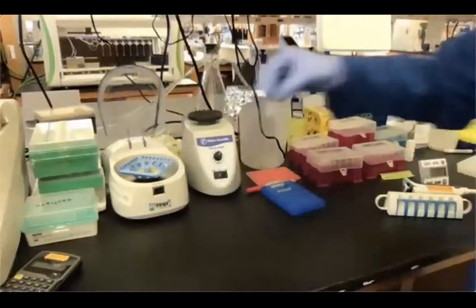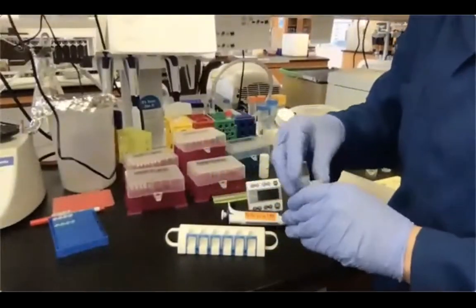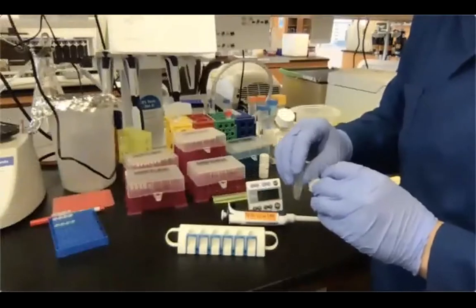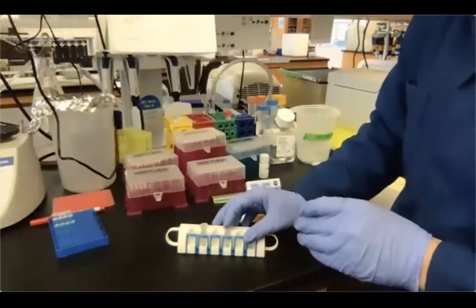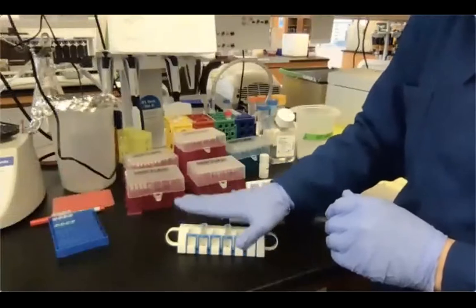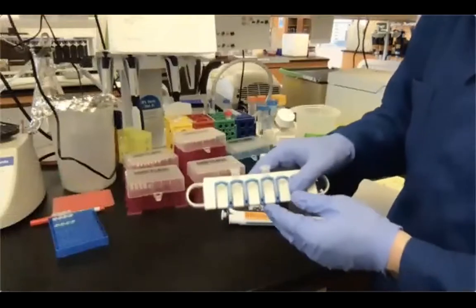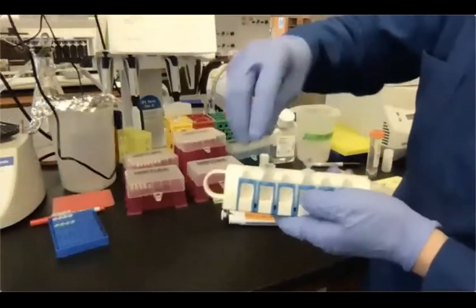One and two. I'm just gonna place my tubes on the magnet, and differently from the first incubation of the tubes on the magnet, this time the separation is almost instantaneous. So it's probably taking like 30 seconds or so. Why is that? Because now the media where the beads are in is not viscous. It's just basically a water aqueous solution, right? So before it was very viscous. So it took like a little bit of time.